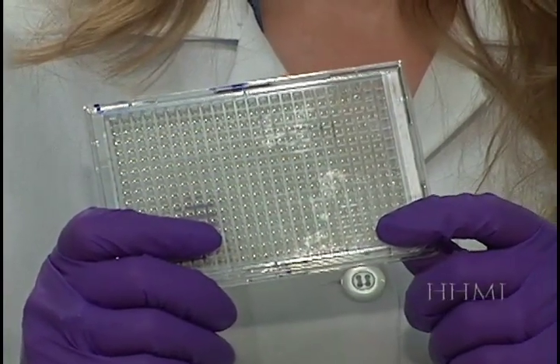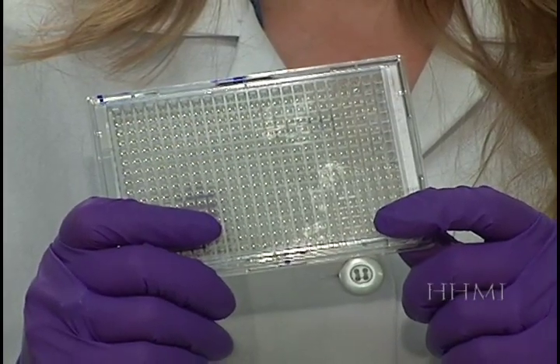At this point, the plates are placed into the incubator to grow for another 18 to 20 hours.